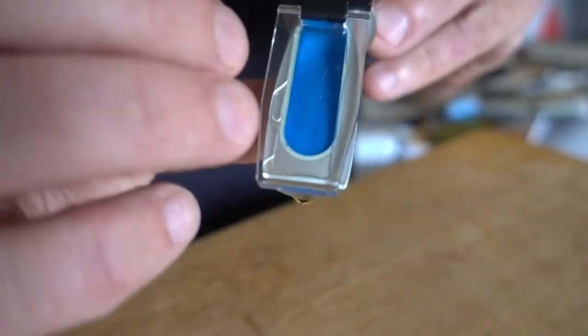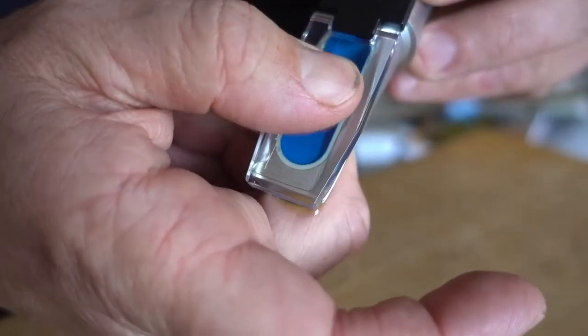I think more is better than less so I'm just going to squish it on and make sure there's no bubbles in it. It's pretty hard to do that actually, there we go I think that's it. All right let's take a look.